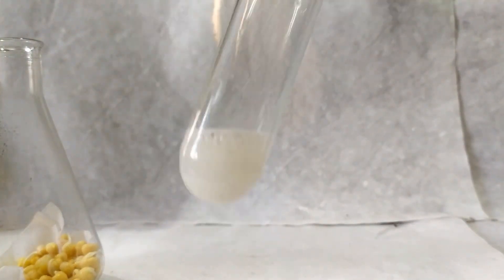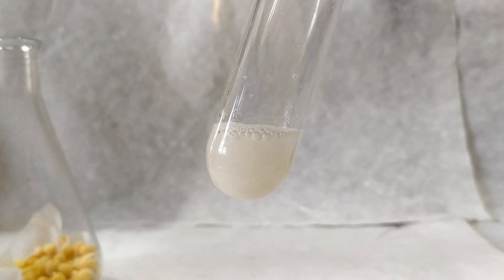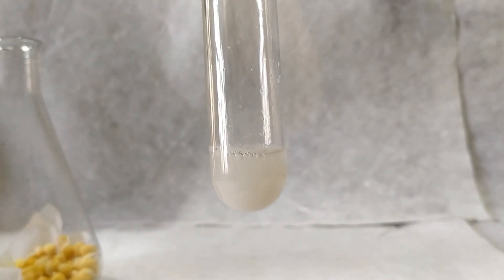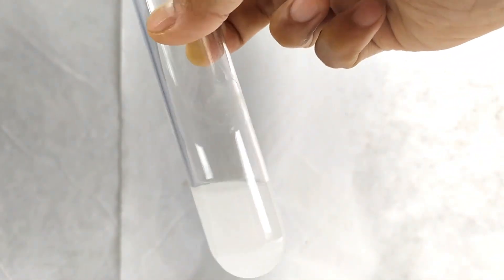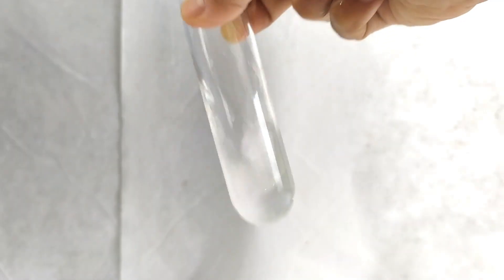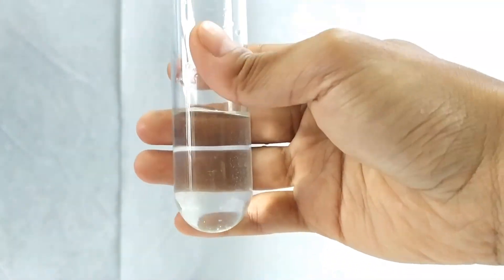This is due to the reaction of calcium hydroxide, which is lime water, with carbon dioxide to form insoluble calcium carbonate. To prove that it is indeed calcium carbonate, add a few drops of dilute hydrochloric acid to the milky lime water. The white color disappears because the hydrochloric acid reacts with calcium carbonate to form a water-soluble calcium chloride.